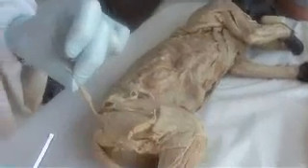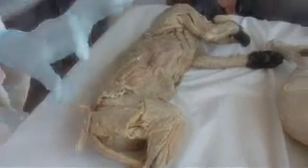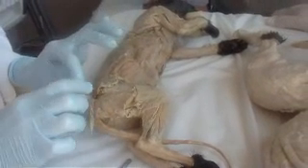On my cat: this is my biceps femoris, right above that is the tail — caudofemoralis. Caudo means tail. My gluteus maximus is in two pieces, and you need to be able to identify that on the test even if it's not pinned, to locate everything else. Remember, gluteus maximus is smaller than gluteus medius — the medius is the meaty one.